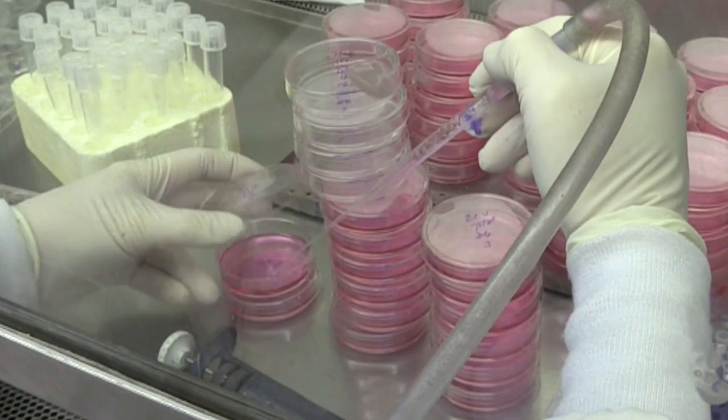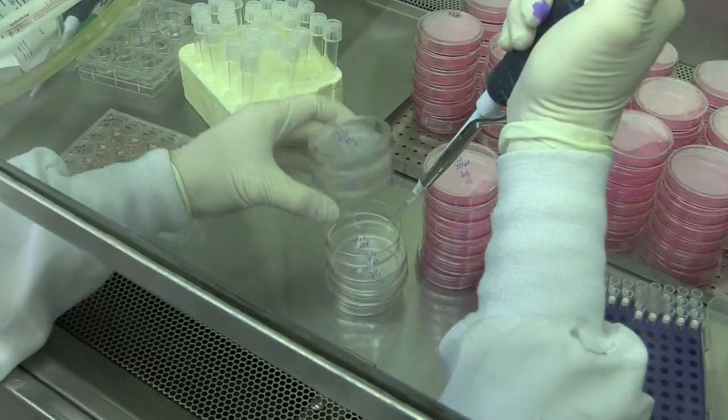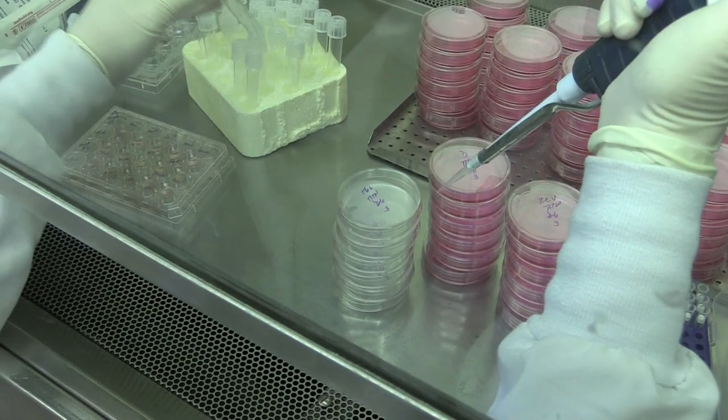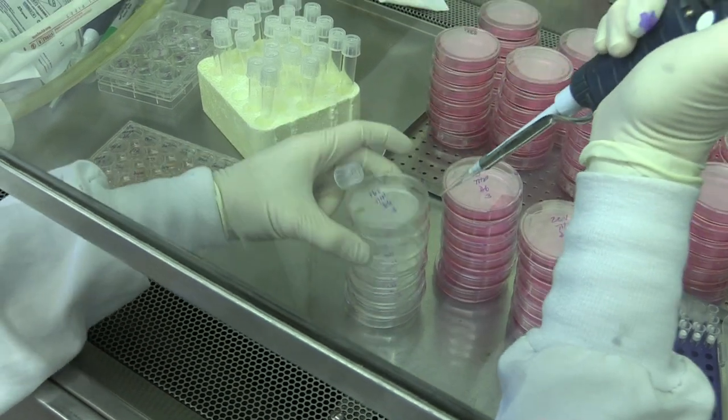How far you dilute depends on how well your virus grows. You want to end up with between 10 and 100 plaques on each plate to get reproducible numbers. Next, we remove the medium from plates of cells and add 0.1 ml of each dilution.